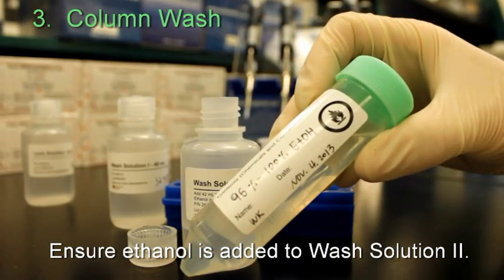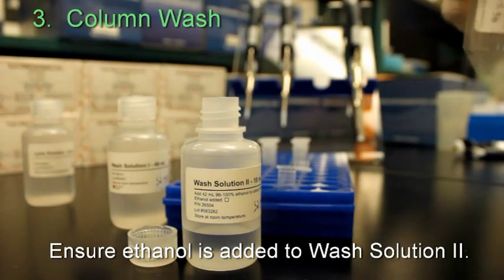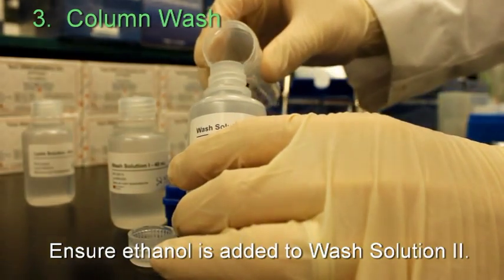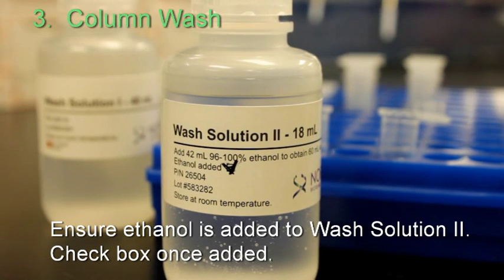Before completing this next step, ensure ethanol has been added to WASH-2 solution. Once the ethanol has been added, check the box on the bottle label.